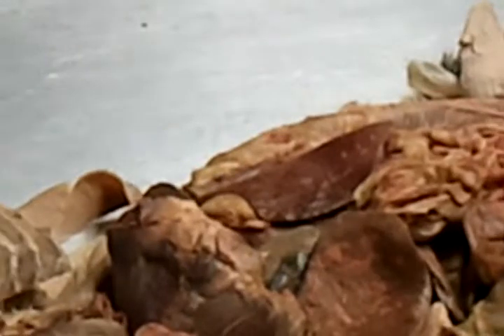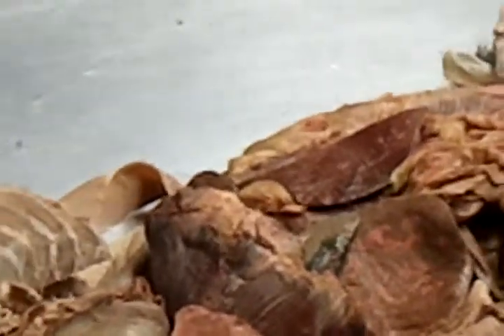Sort of a more leaf-shaped spleen. Humans have a rounded, oval, what's called placoid, like a plate, spleen. And this isn't splenomegaly. This is not an enlarged spleen. A lot of our cats, because they were street cats, had lots of infectious processes going on, and their spleen will be really big. But anyway, this is rather small, but there it is in its normal position.